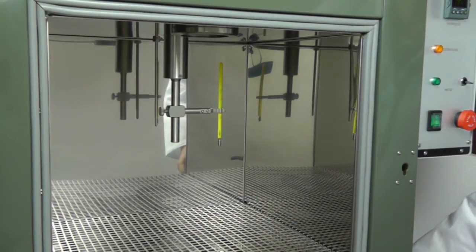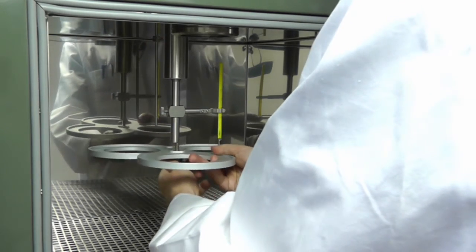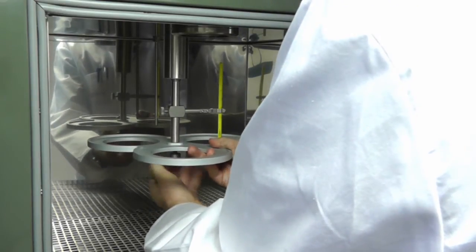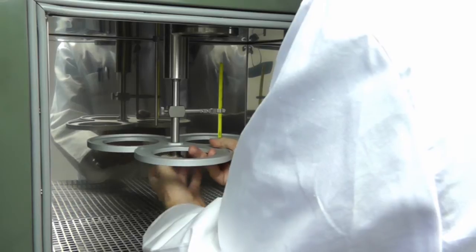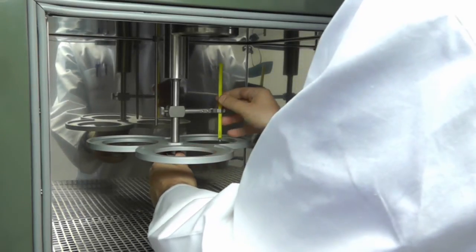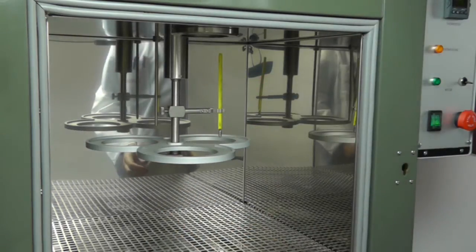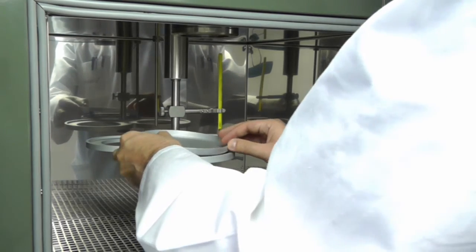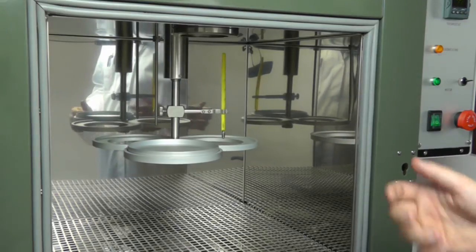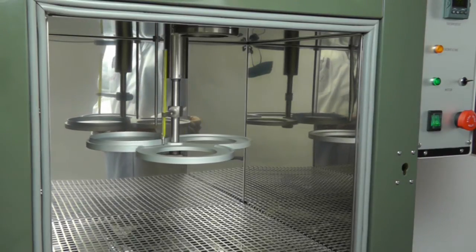Now let's take the D1754 shelf and fix it. So once in position, adjust the thermometer height. You can insert the sample and that's all. At this point you can run tests according to ASTM D1754.